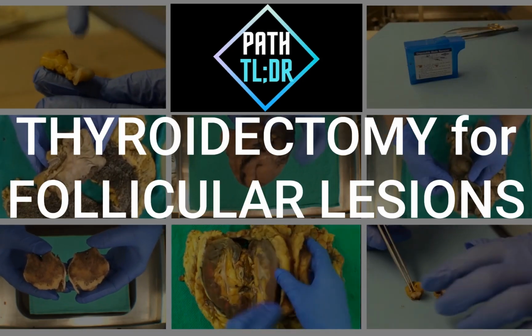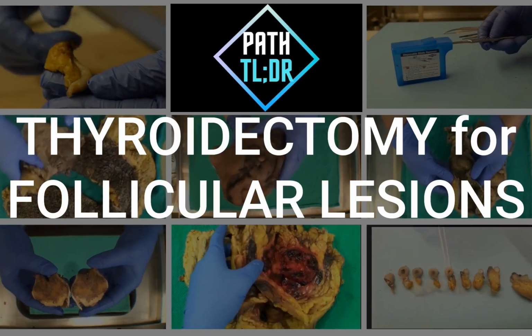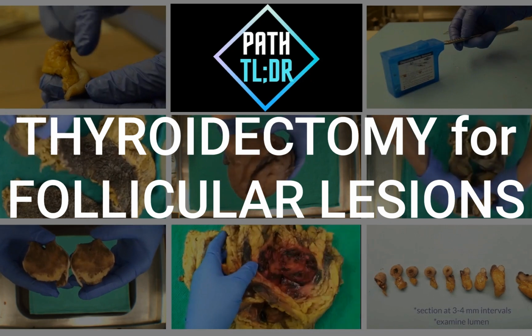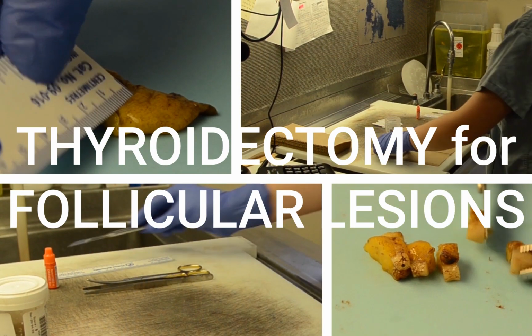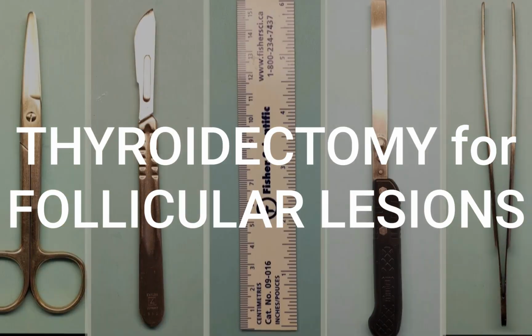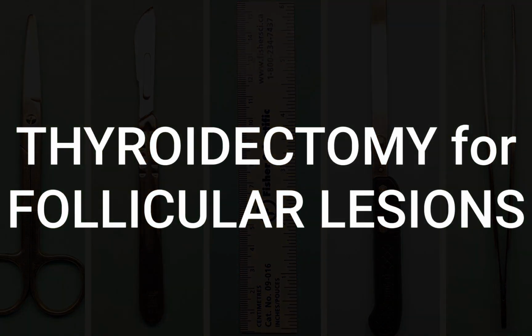In this session, we will go over several multinodular goiter thyroidectomy specimens. We will go over gross features and take you through grossing for both benign and possibly malignant samples. Sit back and let's get started.